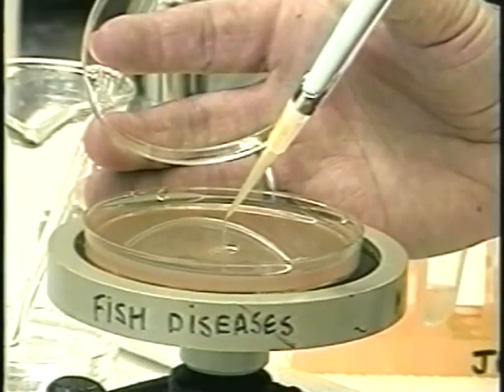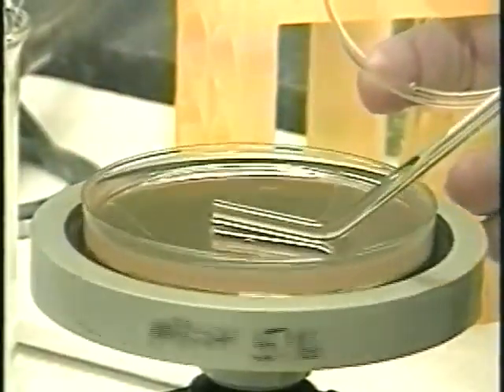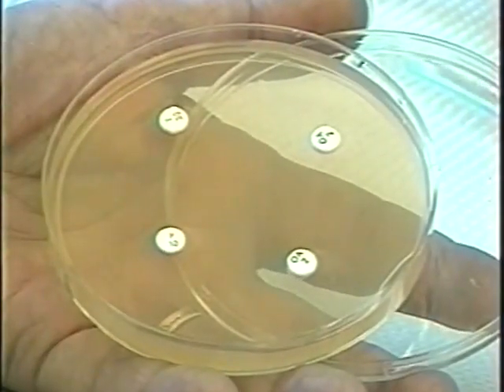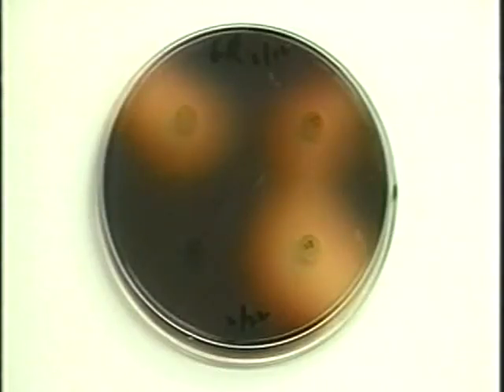In this assay, a culture grown from a single isolated colony is spread onto a fresh agar plate to create a confluent bacterial lawn. Then discs impregnated with antibiotic are placed onto the agar. The bacteria are allowed to grow for 24 to 48 hours, then observed for the circular zones of inhibition surrounding the antibiotic disc. The larger the clear circle, the more sensitive the bacteria is to the antibiotic. The protocol described here is a quick method for determining the relative sensitivity, but standardized and more quantitative protocols are becoming more commonly used.